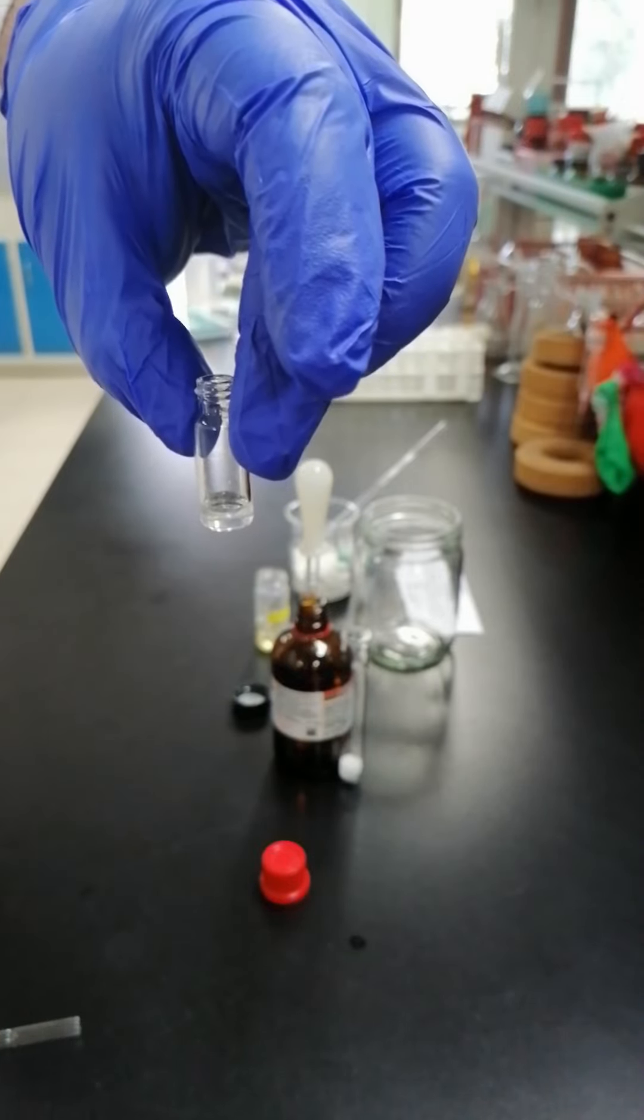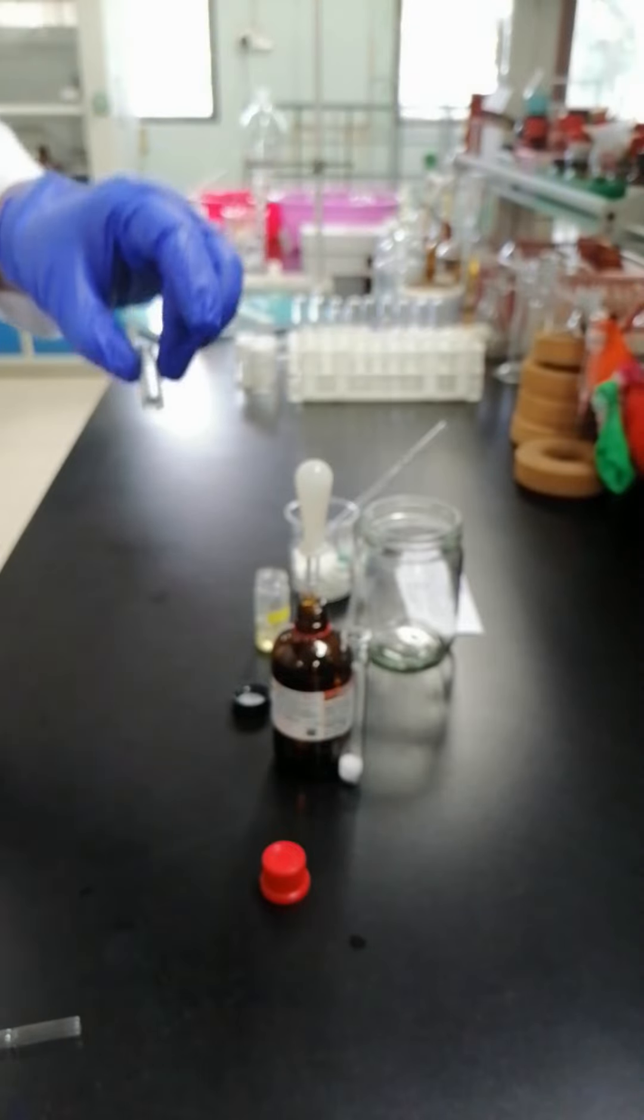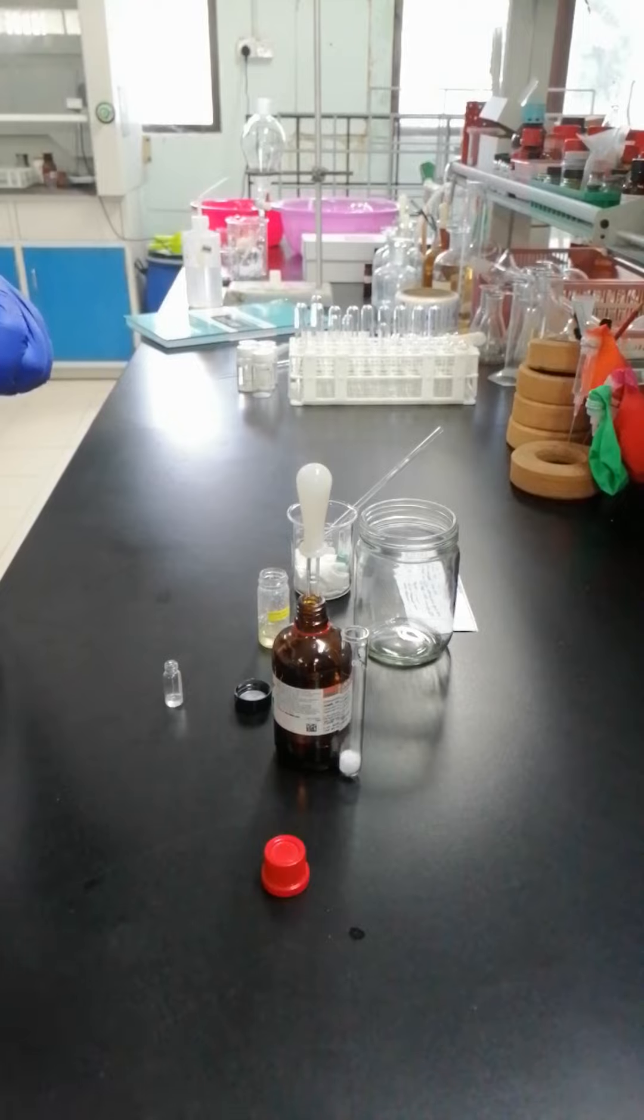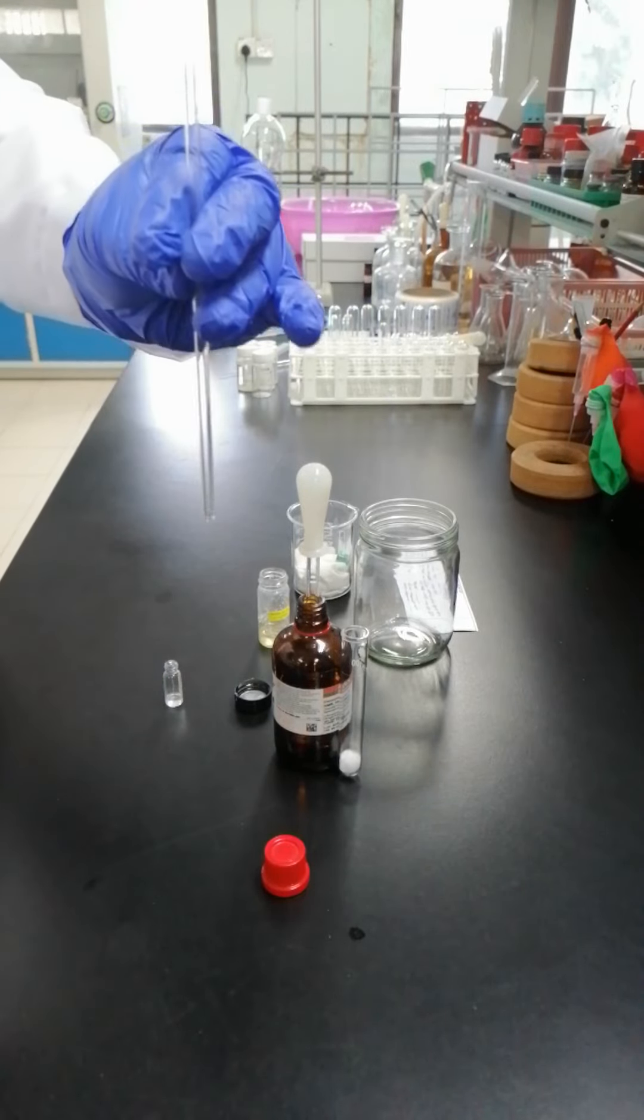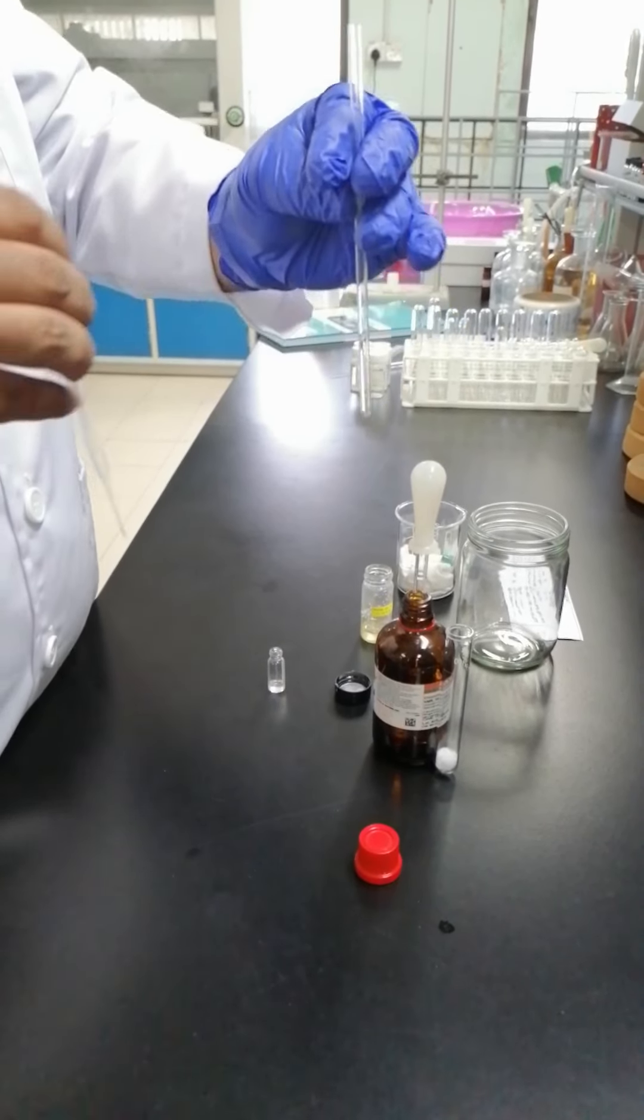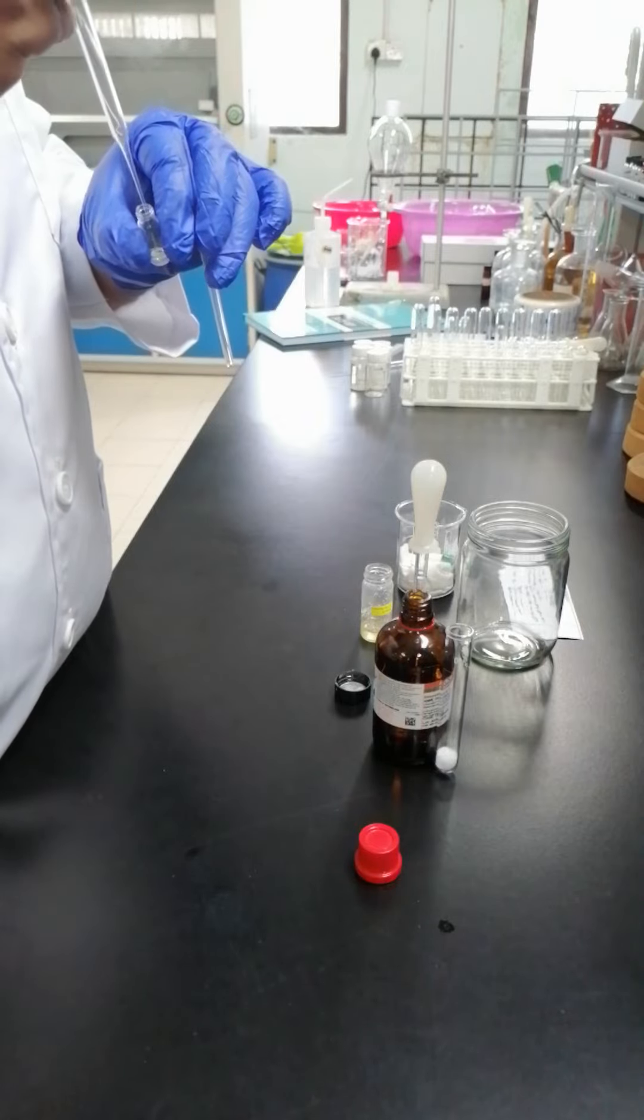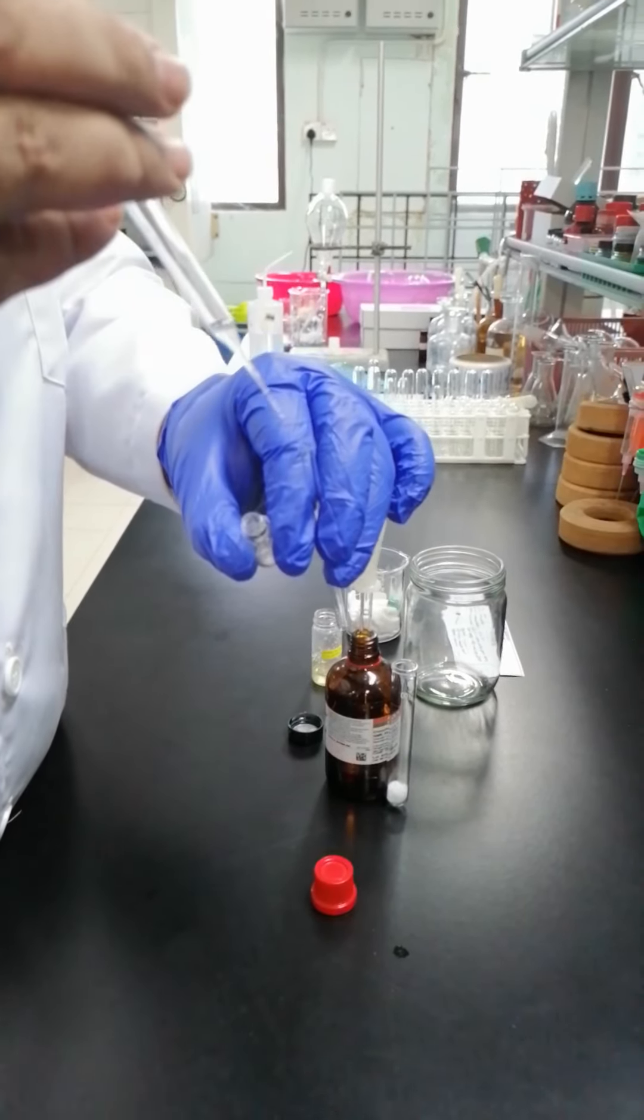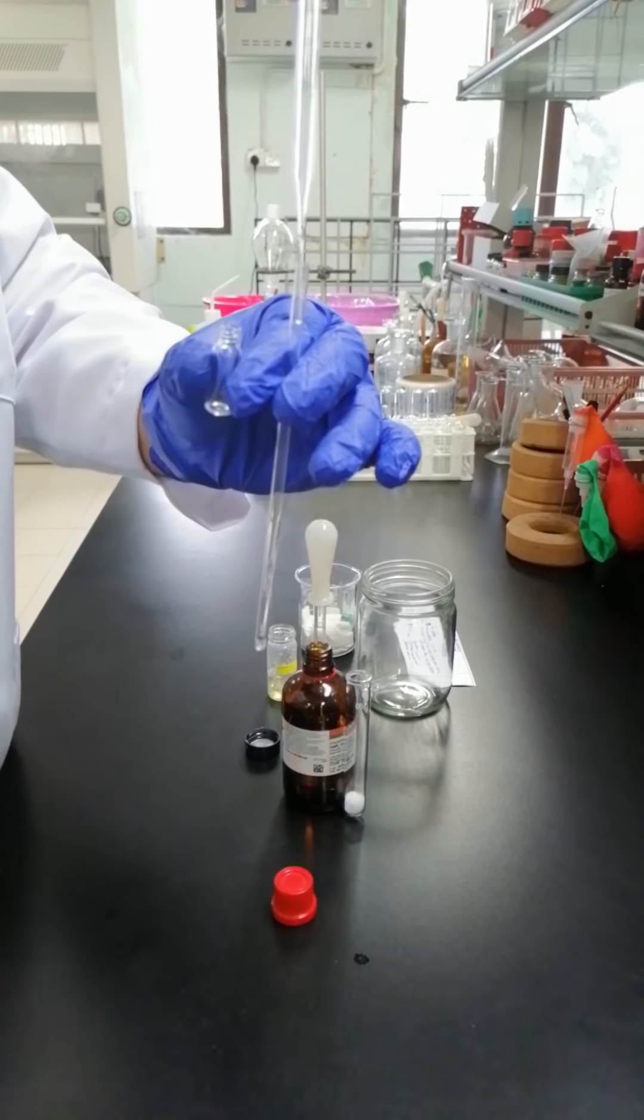And after that, I have to transfer to the NMR tube. Here we have a 5mm NMR tube and transfer all the samples that we have in small vial to this NMR tube.